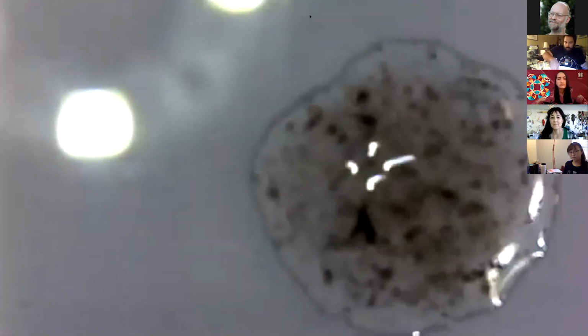So next thing, we're going to get our little cover slip. And if I can open it. Hopefully these cover slips don't go flying across my apartment and I get little shards of glass kissing me. All right, we got our cover slip. Oh, that one's kind of gross. Let's get a better one. You always got to be careful with these vendors. You never know when the cover slips are clean or they're a little odd or whatever. So there we go. Cool. All right, we got a pretty decent cover slip, so I'm pretty happy with that.